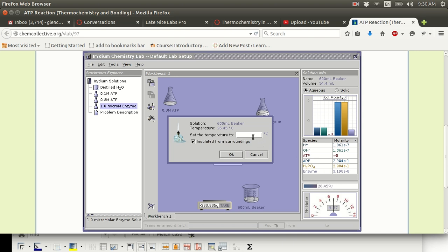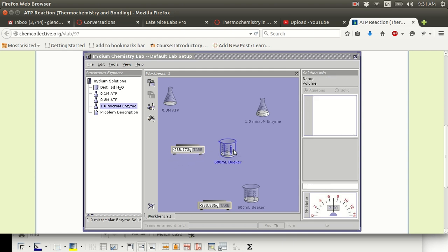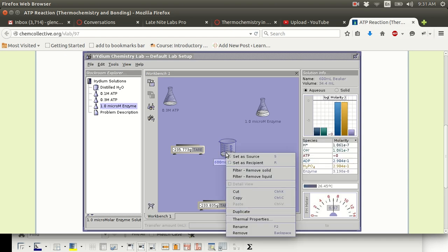Do not set the temperature to anything, however. If you set the temperature to something, you're not going to get the change in temperature due to the enzyme, as you should. So that's it. That's the hint. So those are the two weird things about this lab. The use of the scale. Each scale has to have its own beaker, and then the use of the thermal isolation, thermal properties, insulate. All right.